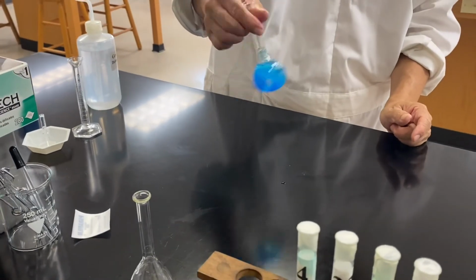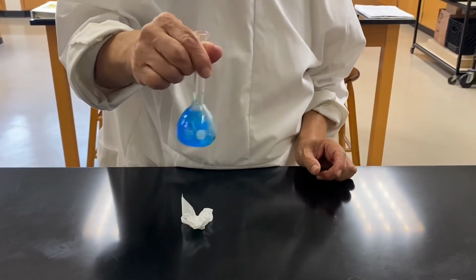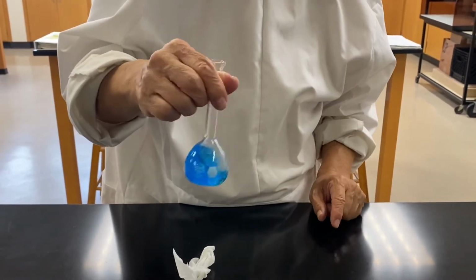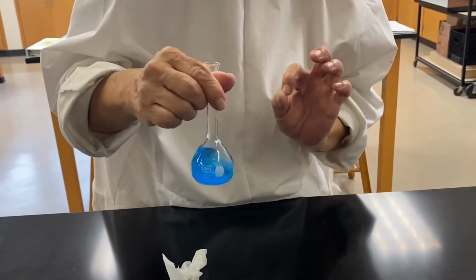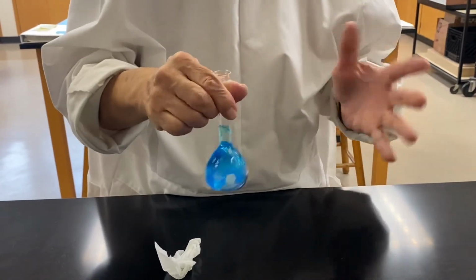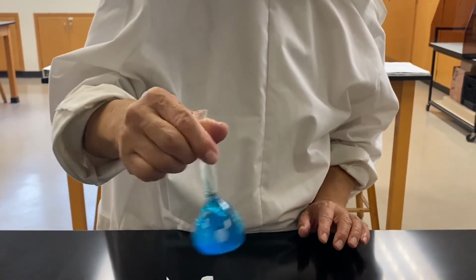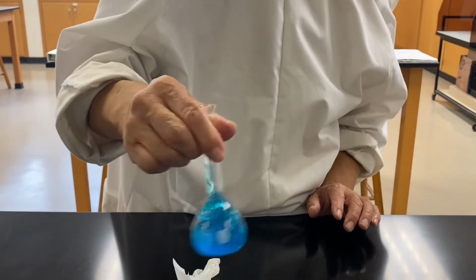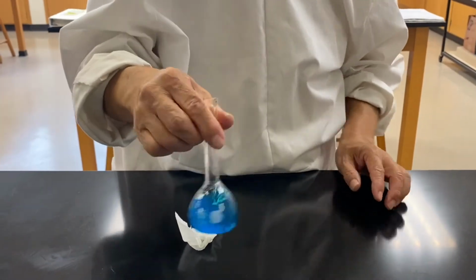All right. Keep shaking until it's all dissolved, totally dissolved, completely dissolved. You don't want to see any solid inside of it. This process takes about 5 to 10 minutes, all right? Your agitation must be effective, so just do it. If one person gets tired, the other person takes over, okay? That's all.